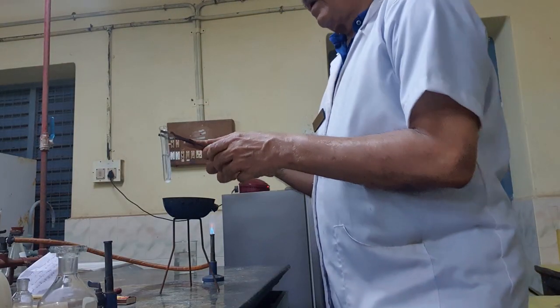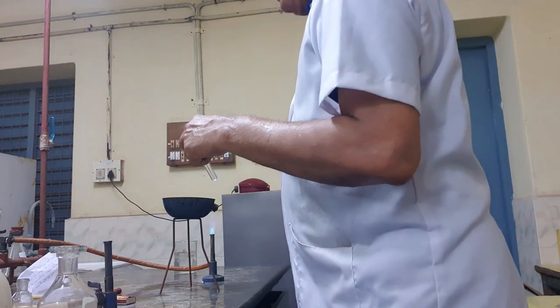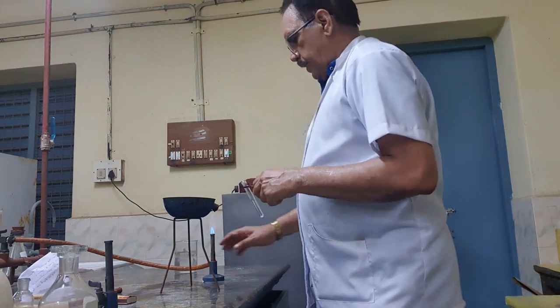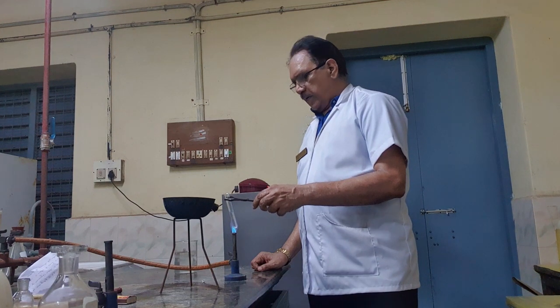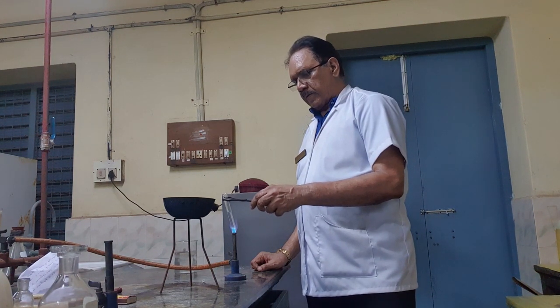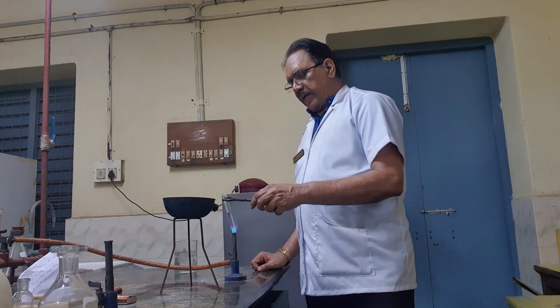Now what I have to do after adding? Now I have to heat in a burner. Kindly follow. I have to heat in a burner.